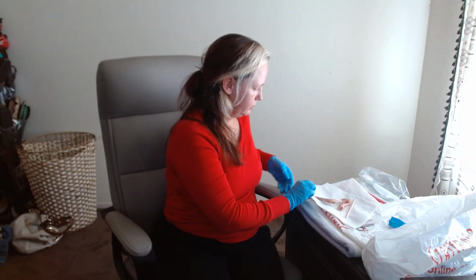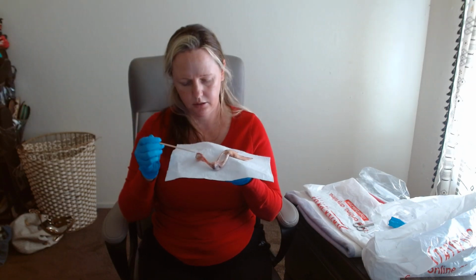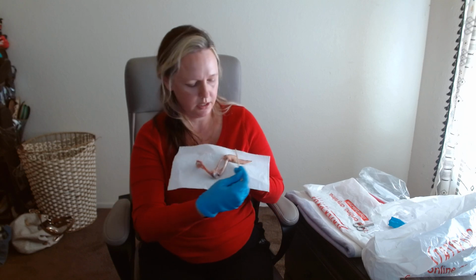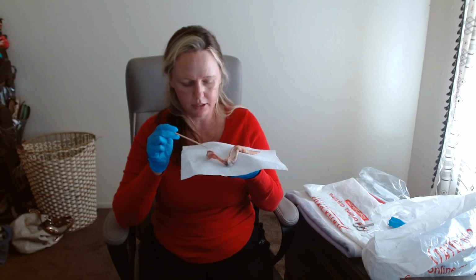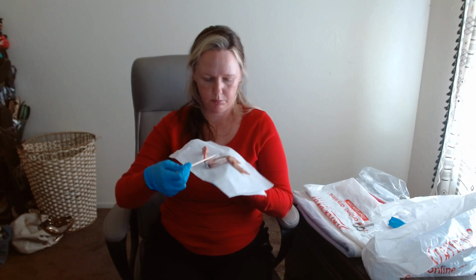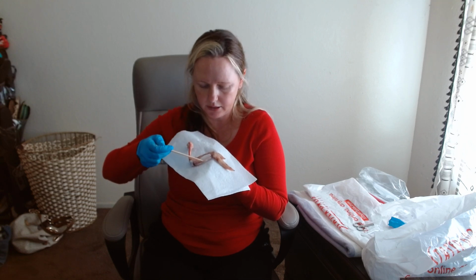So this is my chicken wing. This is the shoulder joint, this is the elbow joint, this area is the lower wing. This right here is the humerus, this is the head of the humerus, this is the articular cartilage. Moving on, this is the ulna, this is the radius. The ulna can be identified as it is the bigger bone.